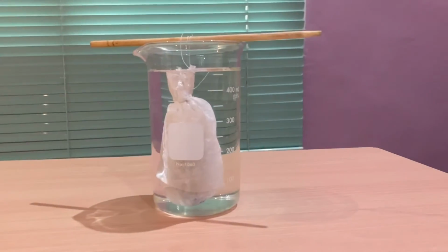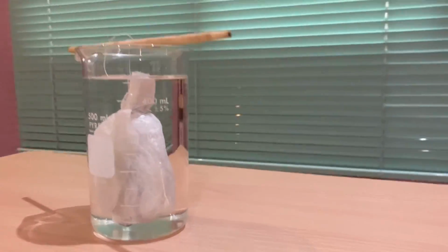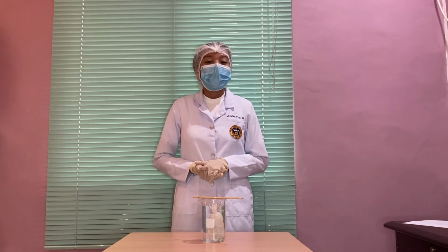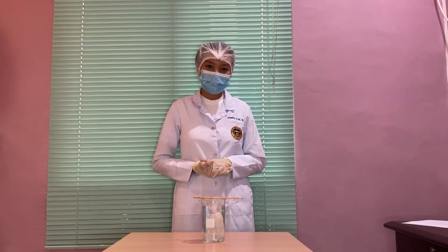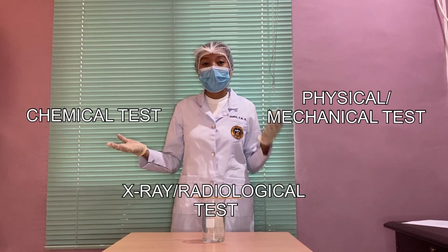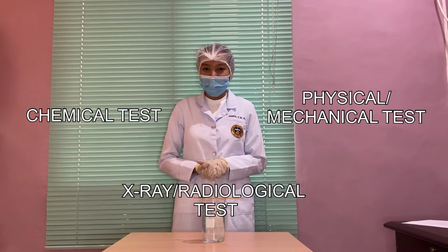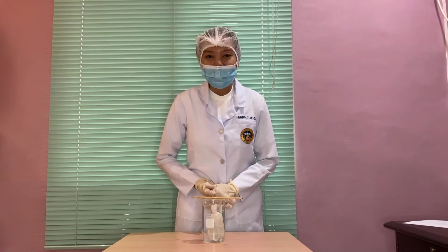Fifth step, allow the tissues to decalcify for 12 to 24 hours. After 12 to 24 hours, you can actually test the extent of your decalcification process using various methods. It could be physical or mechanical tests, chemical tests, or X-ray or radiological tests. Using these various methods will help you determine the endpoint of your decalcification. This would be all for our manual decalcification process. Thank you so much.